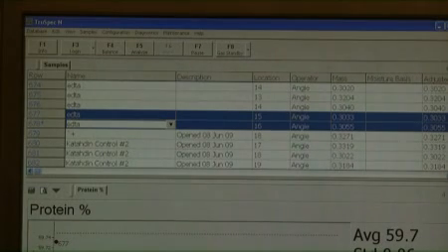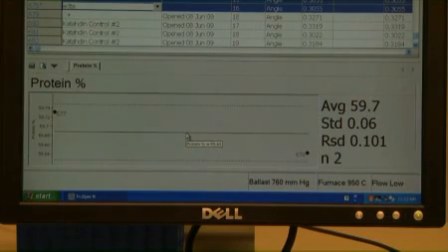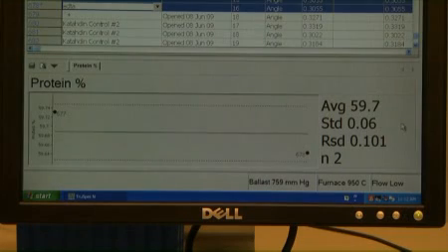Once all of the EDTA standards are complete, select the 2 EDTA run lines in the spreadsheet that are closest in result and nearest to the end of the run. Highlight the results to view the statistics. The statistics appear in the lower right of the screen when more than one line is highlighted. Select the line combination with the lowest %RSD value to be used for the blank. The %RSD is shown as RSD on the screen.